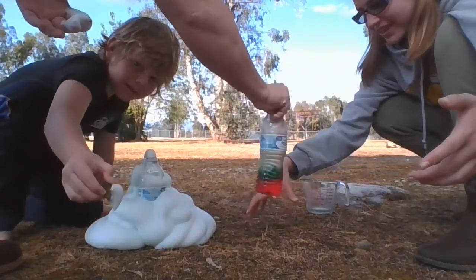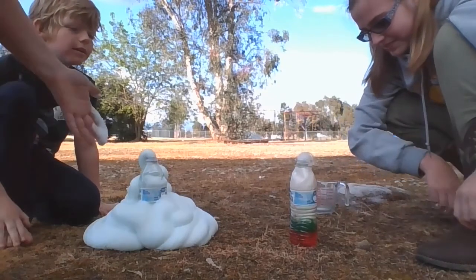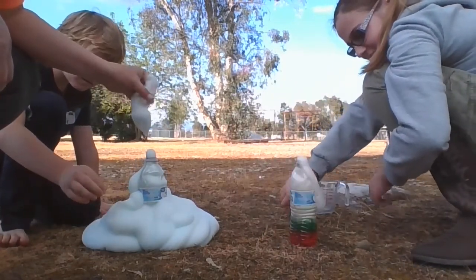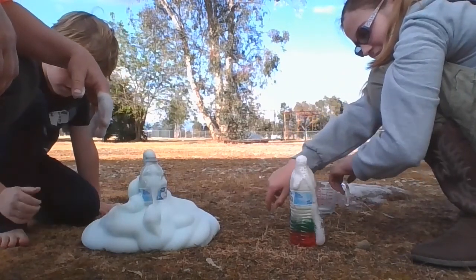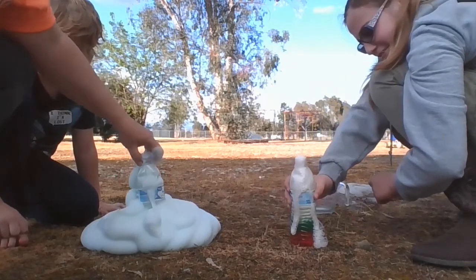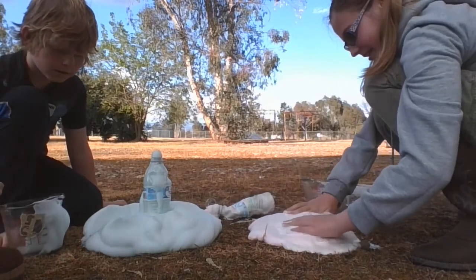So you can see if we kind of shake Josie's. Now we're getting something to start, Josie. Yeah. Oh, there we go. But you can see the one with the warm water most definitely caused this reaction to really happen and just go crazy. Okay. It's still going. And you notice Josie's is happening, but it's happening really slow. And it's not as fun because it's just not making as much. Of course, Josie will probably shake it up in a minute. But if you look, even with this one, you can see how fast it is. I mean, there's hardly anything left in this blue one. Okay? So, fill in B and C.